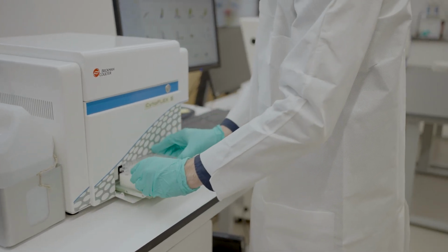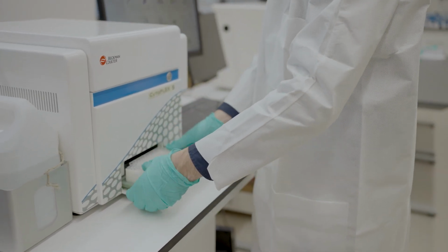Another thing that I find very appealing is how easy it is to perform autofluorescence extraction on the instrument. I have users with highly autofluorescent and complex tissue samples, and for them, adding multiple autofluorescent signatures is critical to get an optimal unmixing.